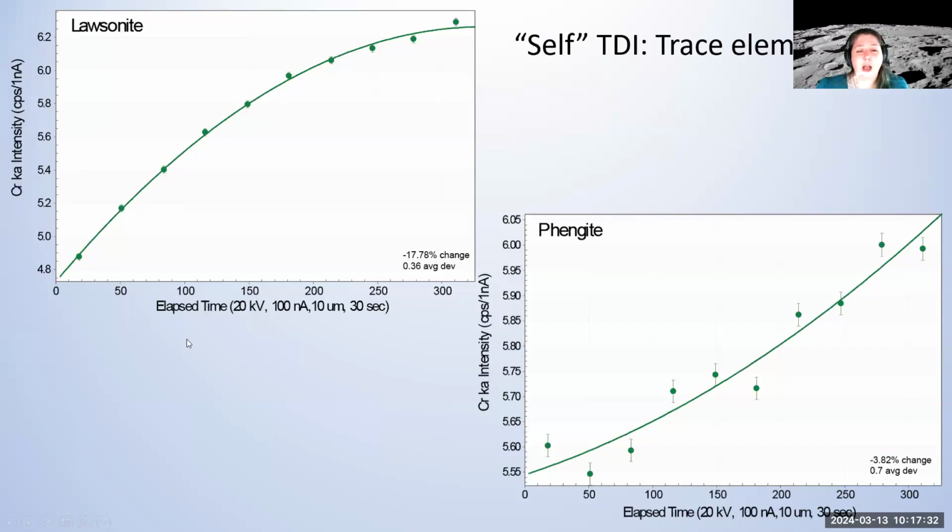So here are two examples for very hydrous, very beam-sensitive materials, a lawsonite and a phengite, and we're looking at the chromium intensities during the analysis. Usually no one ever thinks that chromium could be an element to monitor, but during the analysis, because we damage the overall composition of the material, you see that I get an increase in intensities, probably because my mean atomic number increases due to devolatilization, but it's a 20% increase. So not tracking that and not correcting for it, I get a very large error in my accuracy on the data. Likewise, the phengite, we get a different curve, but also an increase, and it is like a 4% change in the data.